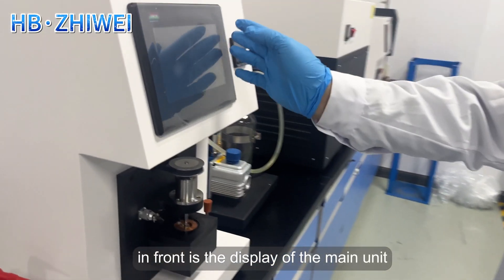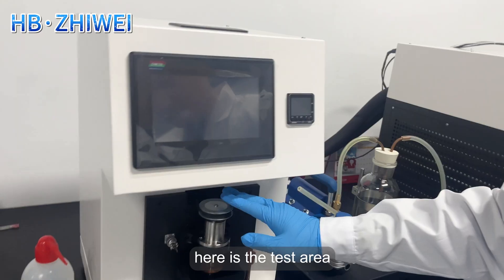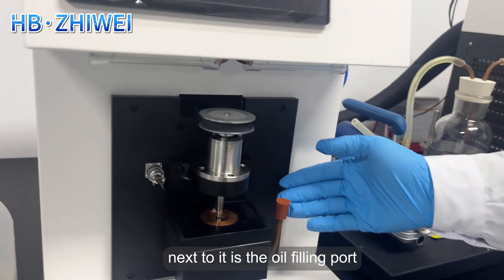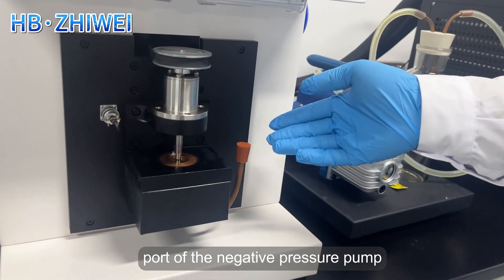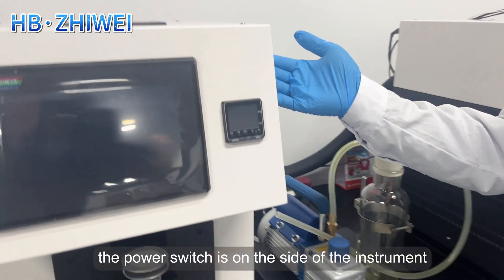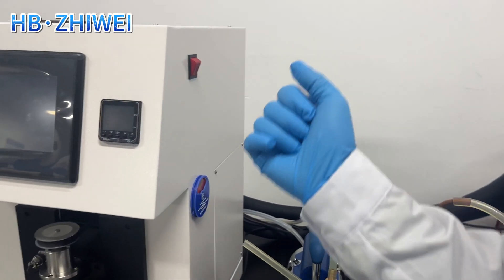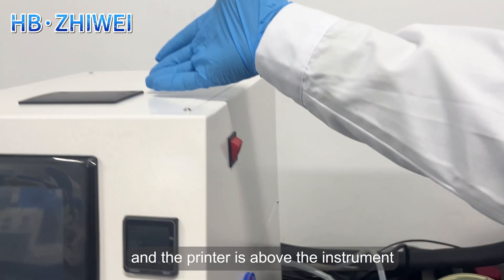In front is the display of the main unit. Here is the test area. Next to it is the oil filling port, which is also used to connect the oil extraction port of the negative pressure pump. This is the temperature control meter. The power switch is on the side of the instrument, and the printer is above the instrument.